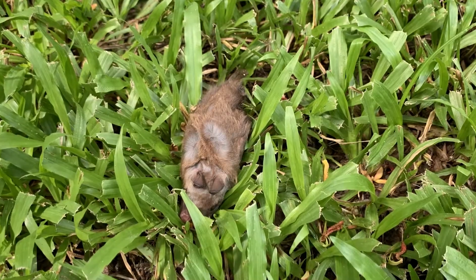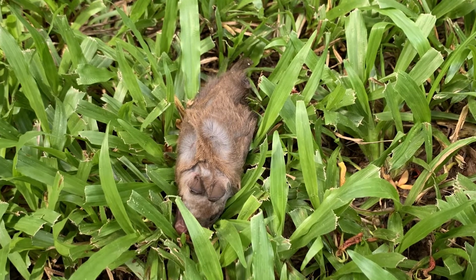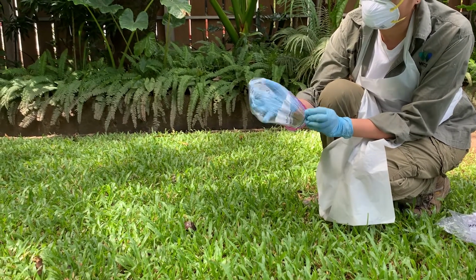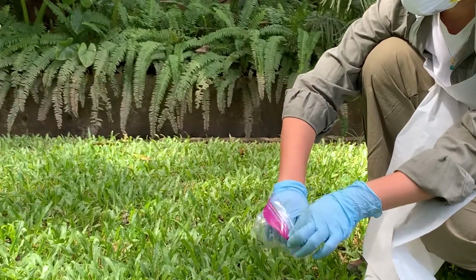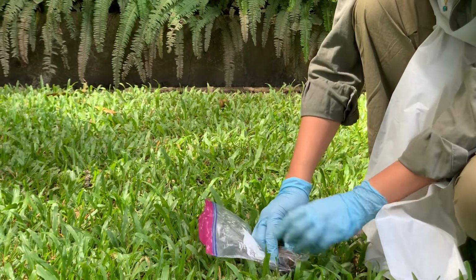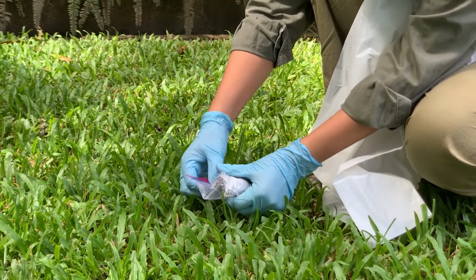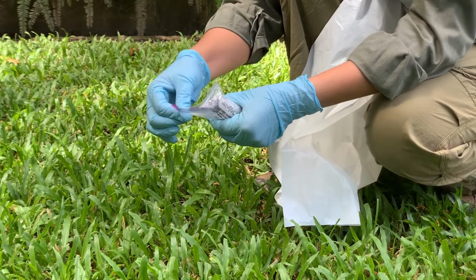Carcass collection. If the carcass is small enough to fit in the carcass collection bag and can be easily carried, collect the whole carcass. To collect the carcass, invert a large plastic bag over your hand. Grasp the carcass and fold the bag over the carcass. Roll the bag away from your body on the ground to expel the air and seal the bag. Your gloved hands should not touch the carcass at any point in this procedure. All carcasses must be bagged individually.